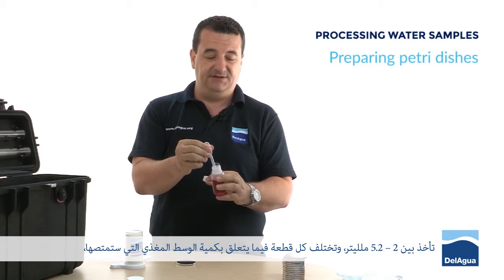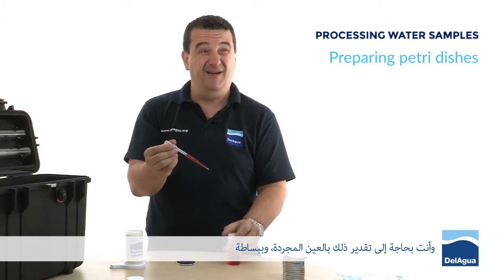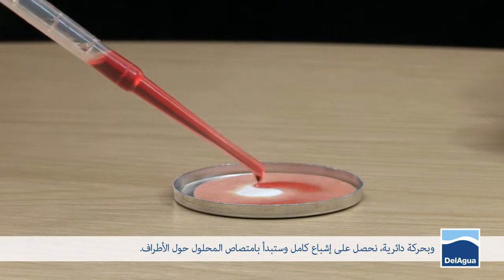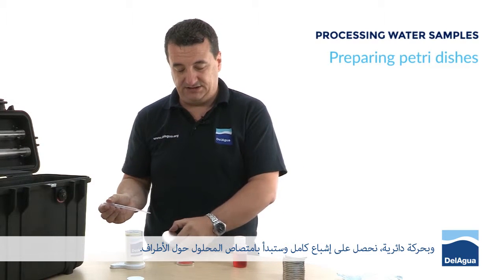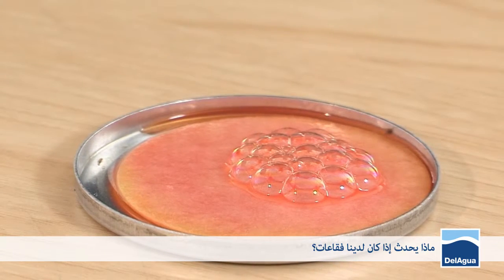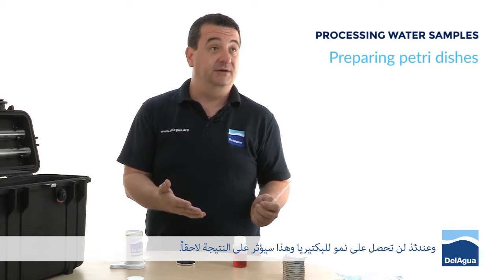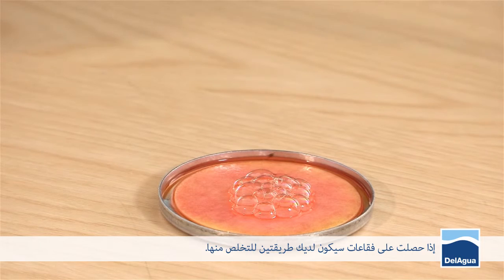Each pad is very slightly different in terms of the amount it's going to soak up, so you really need to do it by eye. Very simply apply it in a circular motion for complete saturation — it's starting to soak around the edges. What happens if there are bubbles? Bubbles are no good — they're going to cause a barrier between the membrane and the food, and then you're not going to get the bugs growing, which will cause a problem with the result later on.